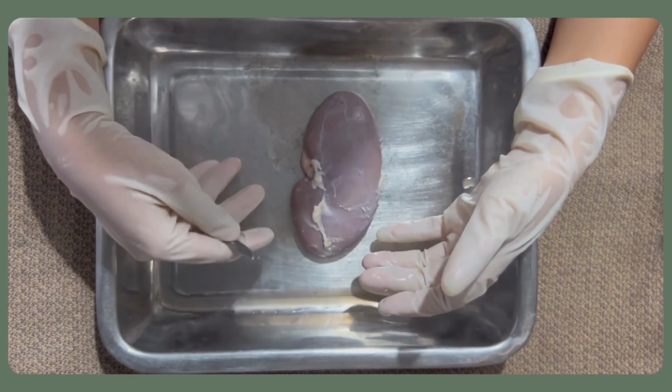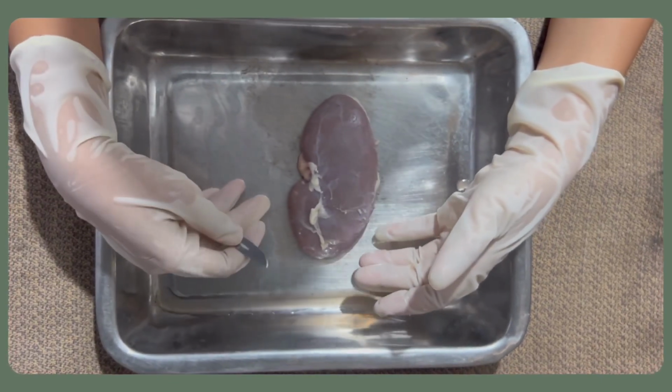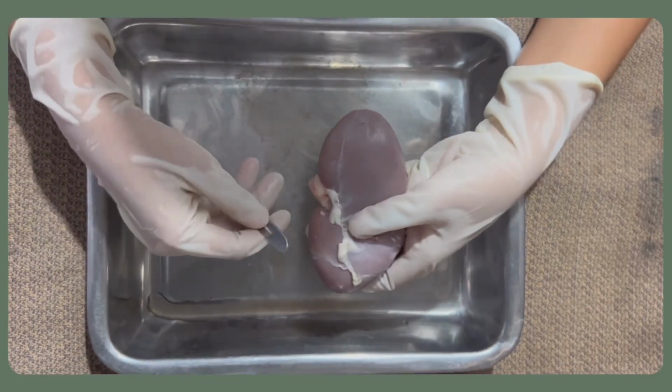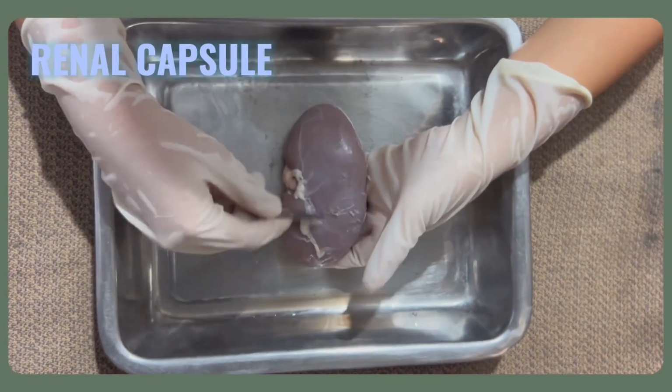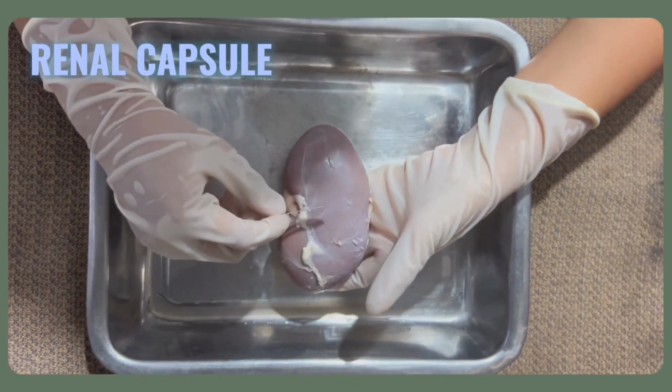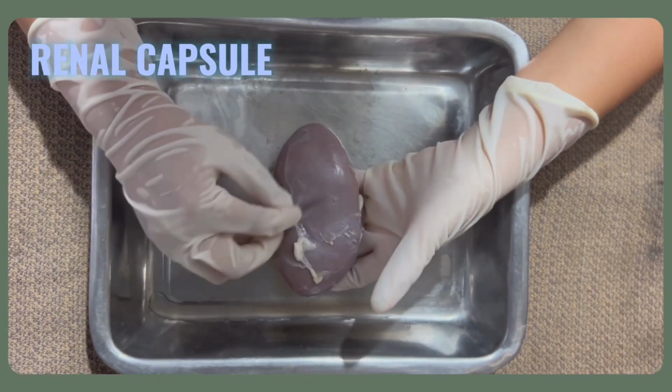So let's start. As you can see, we already have our medical gloves and our other equipment. Let's start by identifying the external parts of the kidney. This is the renal capsule. The renal capsule is a thin fibrous membrane that surrounds each kidney and helps to protect it.